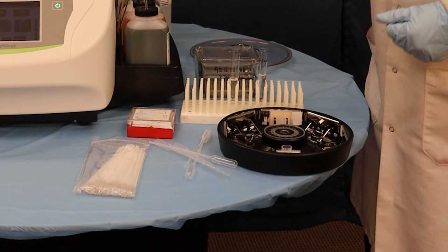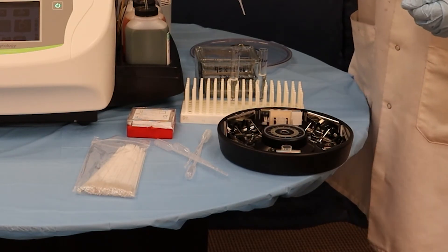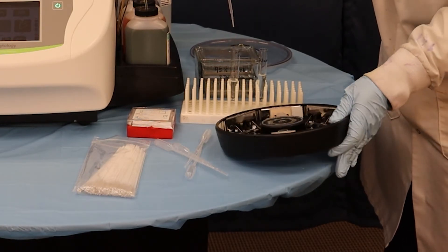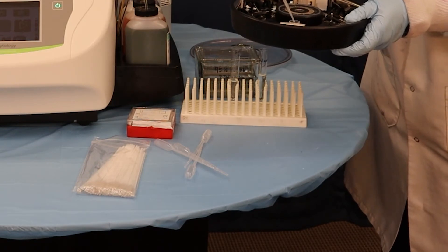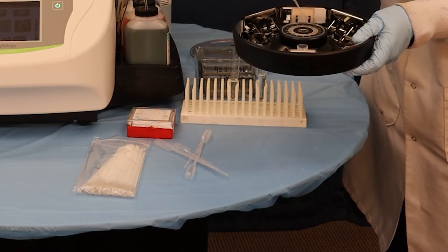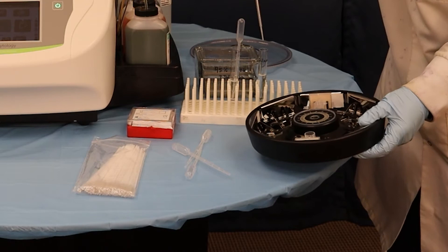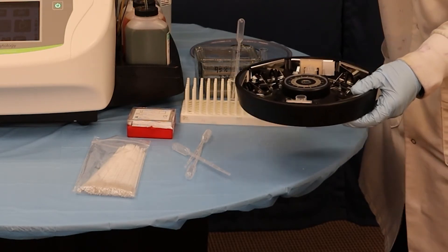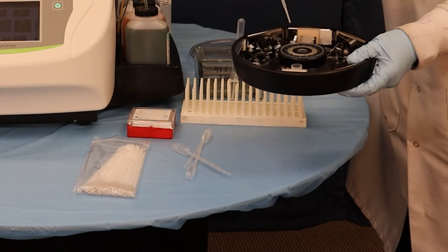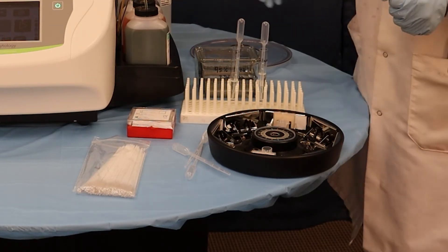Take this and dispose of it. You want between 200 and 300 microliters — about two to three drops. This is a slightly less turbid solution, so we're going to do three drops for this one. You'll do that in each of the chambers. You're then going to go to your diluent, which was the saline solution, and finish out to about five drops total — so two drops in each. That should give you the right ratio to get a good monolayer of buccal cells onto your slides. You can leave that in the tube itself.